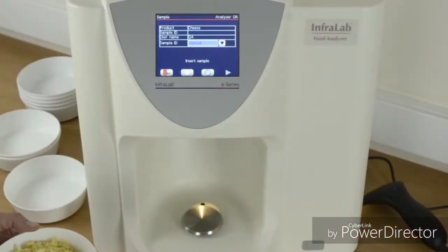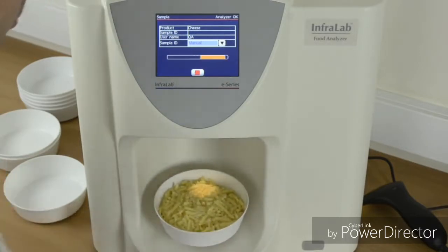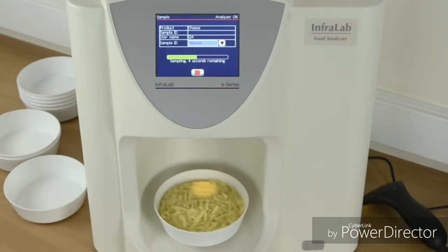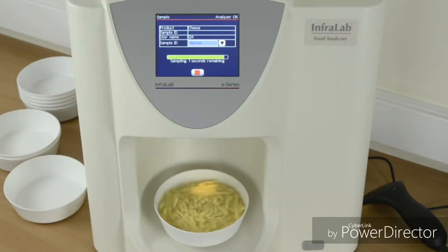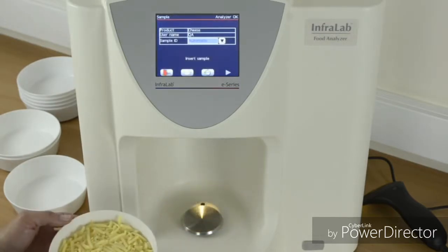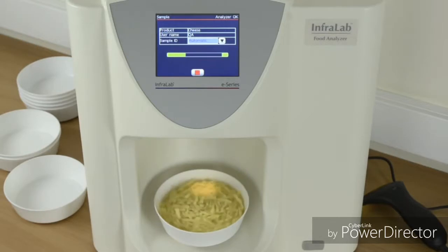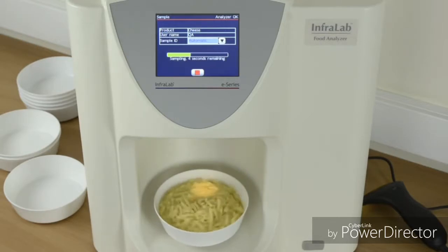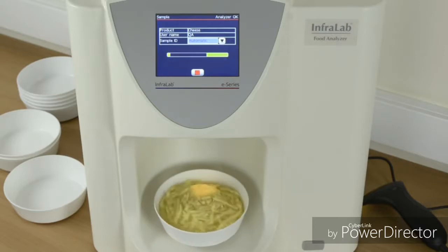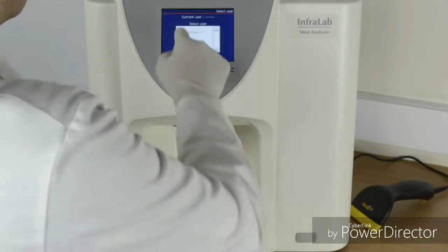To make a measurement, the user logs on and selects the product to be measured. The product can also be pre-selected by the supervisor, so that operators only have to place the sample on the analyzer with no need to touch the screen. Once the sample bowl is placed on the turntable, Infralab automatically begins measurement. Even multi-component measurements are achieved in just a few seconds. Product height fluctuations, temperature changes, and product color variations do not affect the Infralab.